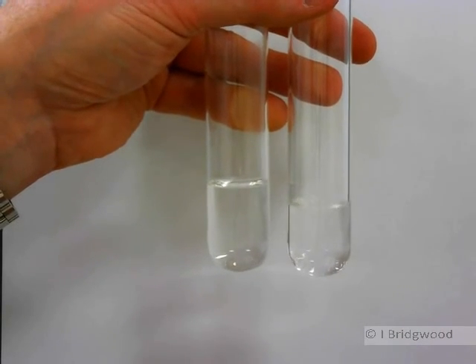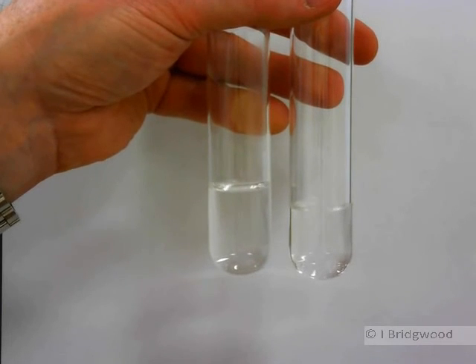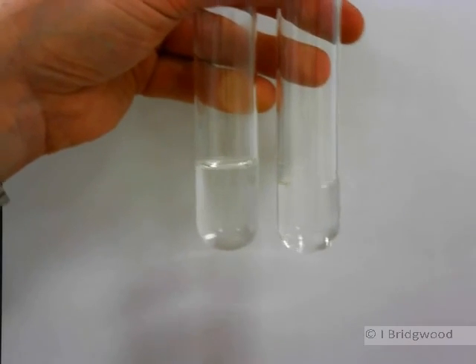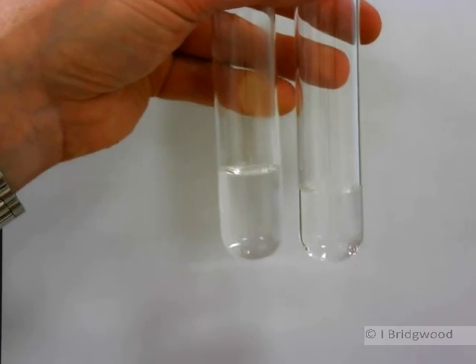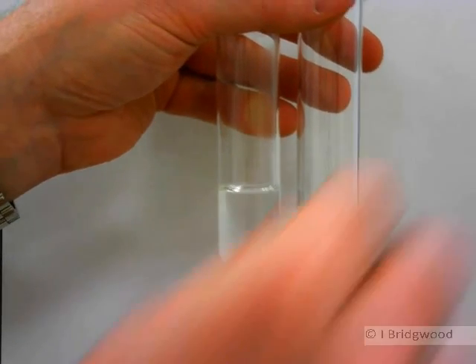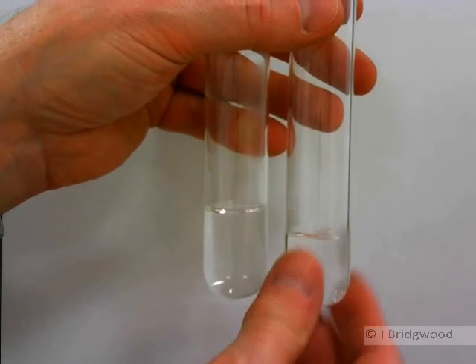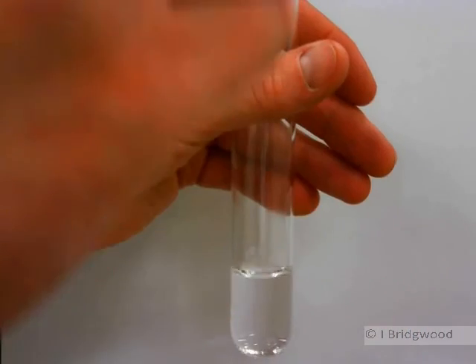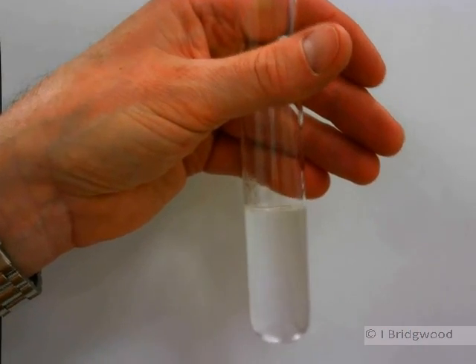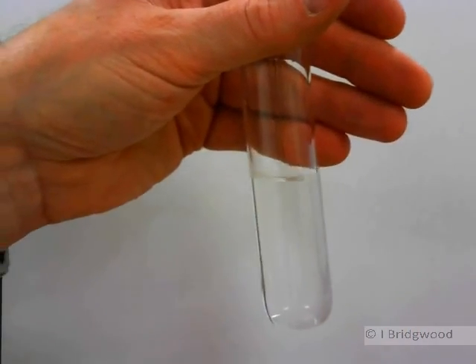The net effect, therefore, is that we have greater or stronger interactions forming than breaking. So therefore, they should mix. So, let's see if they do. Yep. Completely miscible.